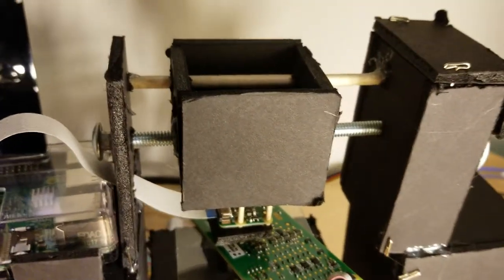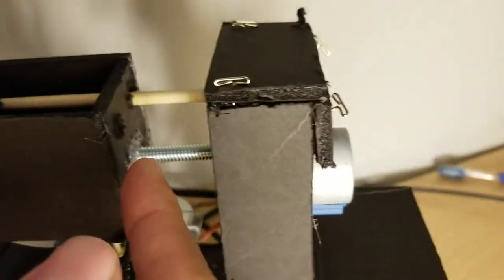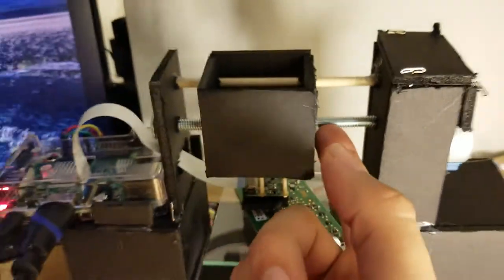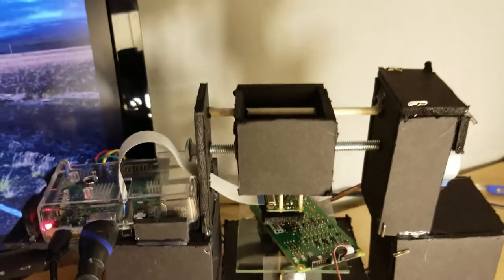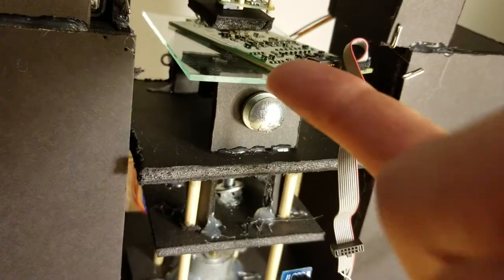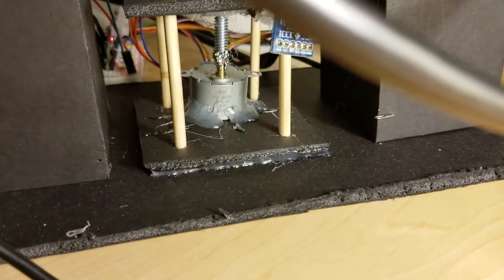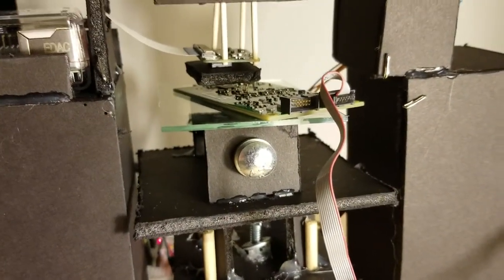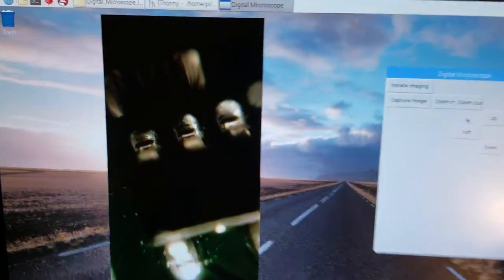What this rail does is, as this servo turns, there are nuts glued into this little box. As this screw turns, it forces this box to scoot along either left or right. I've repeated this process two other times throughout the project. This will force it to go forward and back. And down here, we can get that zoom out and zoom in option by having the object we're observing sit on this platform, which lifts or moves further away from the camera itself. We can see this in action here.